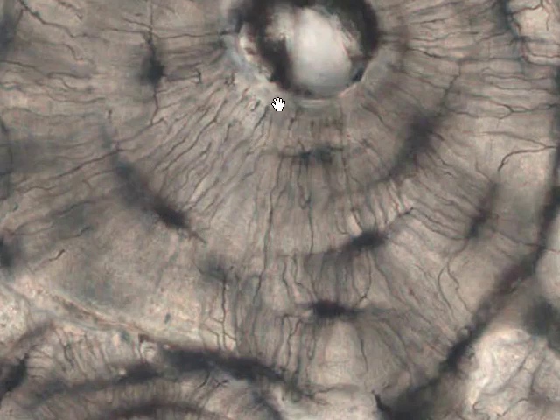These canaliculi extend all the way into the Haversian canal, where there will be communication between this osteocyte and some bone-lining cells. And if we were to look over here, we can see that there are connections between these canaliculi. This would be from another osteocyte, maybe out here somewhere, and these connections enable the osteocytes to function together as a single unit.